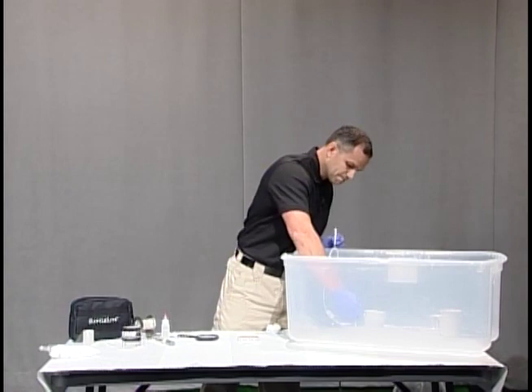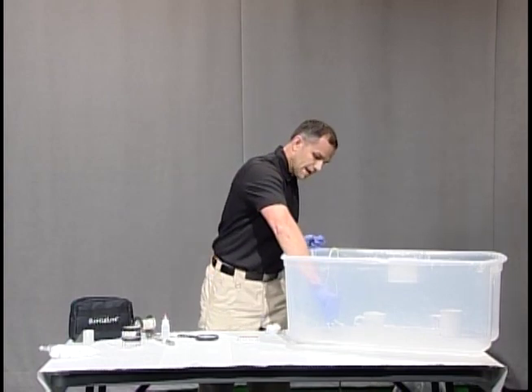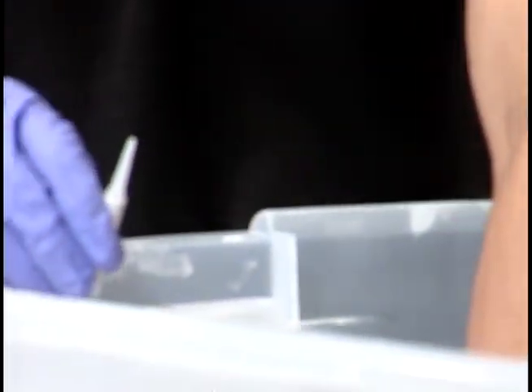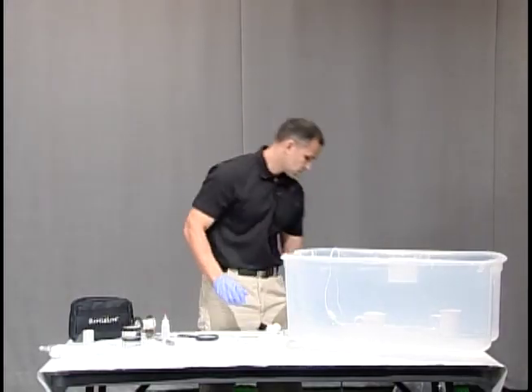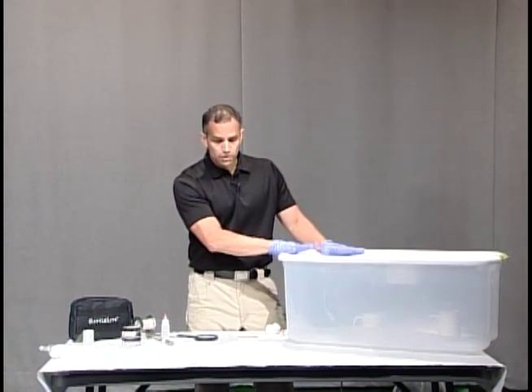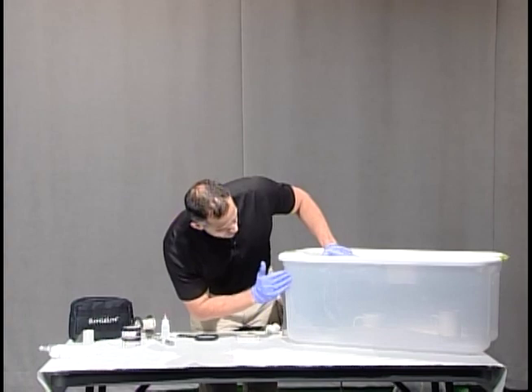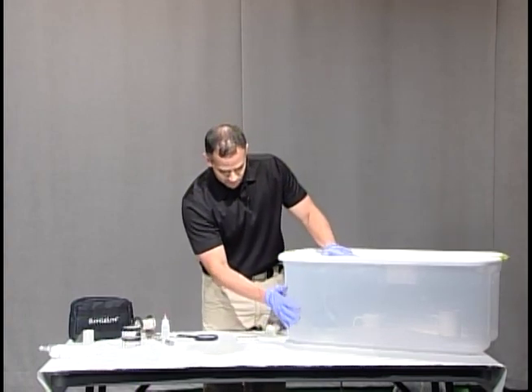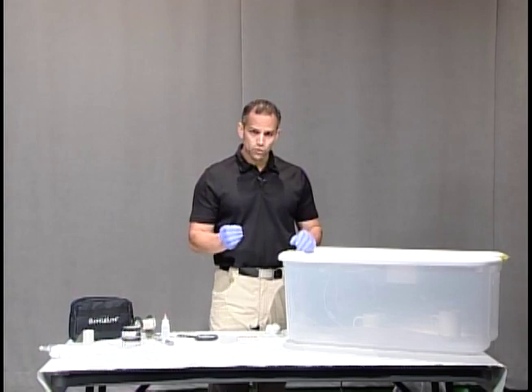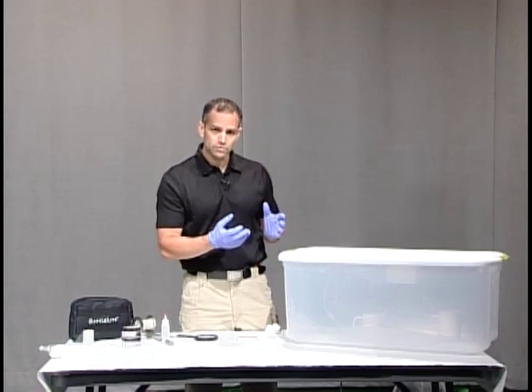I'm going to go ahead and put our mug in. I'm going to use my super glue, adding that to our metal tray. I'm going to put the lid on and now we're going to let that cook for a little bit. You can over fume — and what you'll see, this used to be clear but it's gotten a little bit foggy and frosty because I've used this chamber over and over again. That can happen if you over fume your items, so you want to make sure that you put a check or something on the outside so you'd be able to see when your fuming is done.